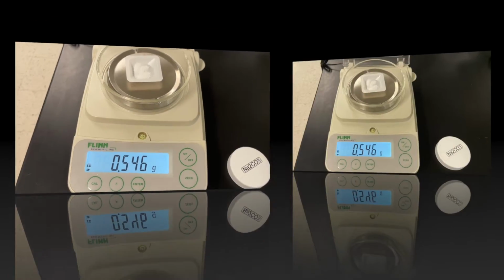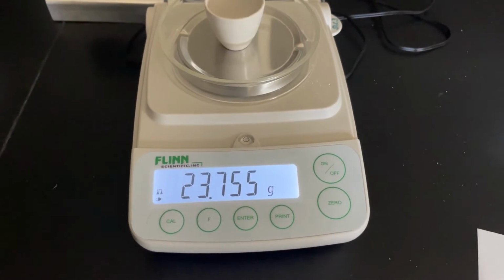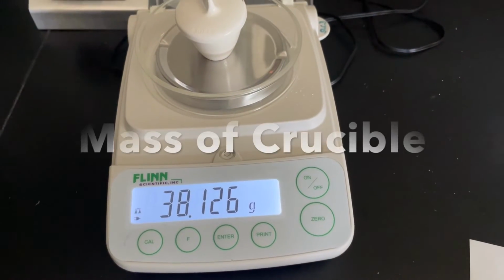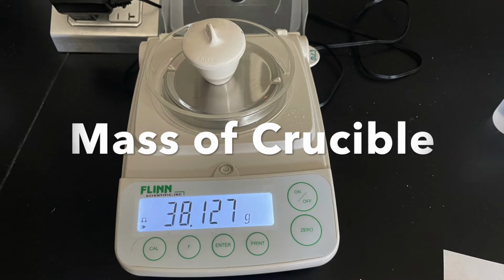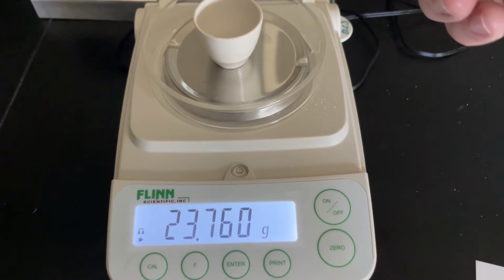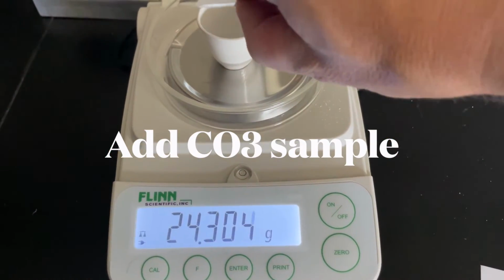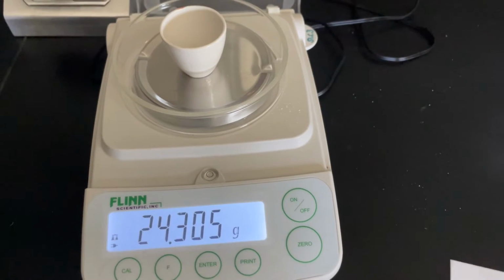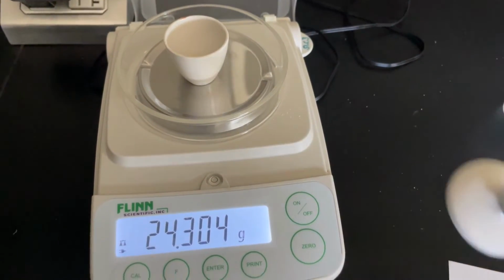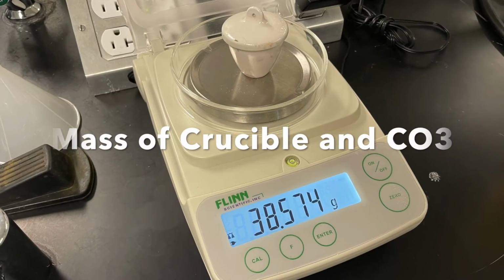So this seems to be a sufficient amount. The next thing that we're going to do is get the mass of our crucible. And so you'll see here that we put the lid on and we will now record the mass of the crucible. The next thing we need to do is add our sample of carbonate to our crucible with lid. And then we're going to record that mass of the crucible with the sample of carbonate in it.